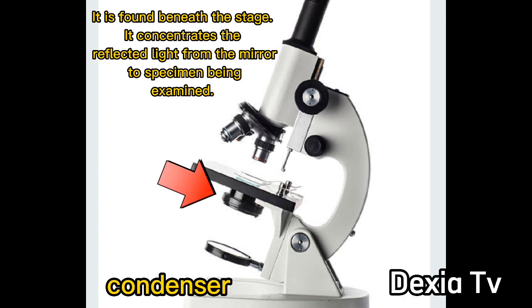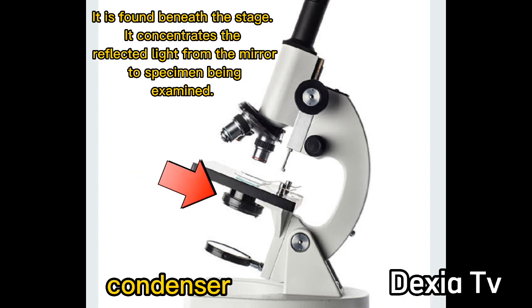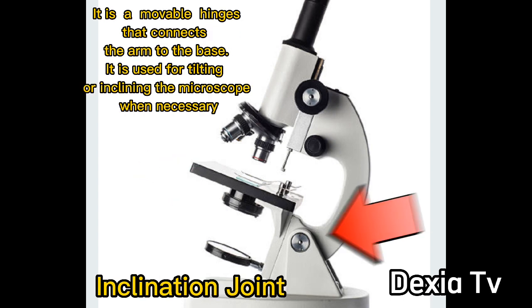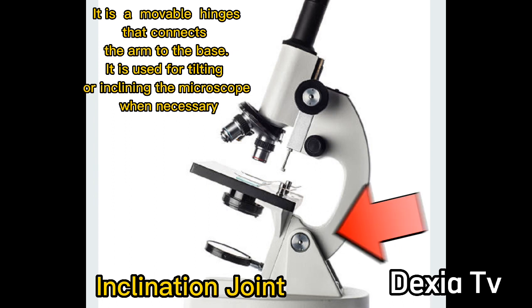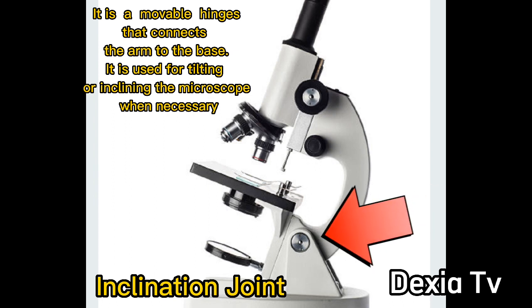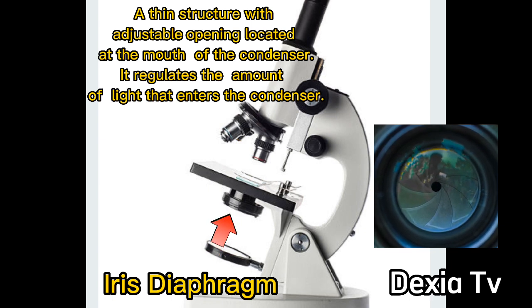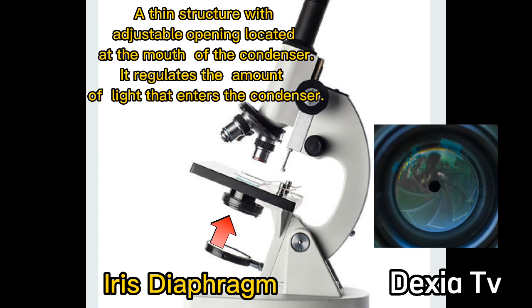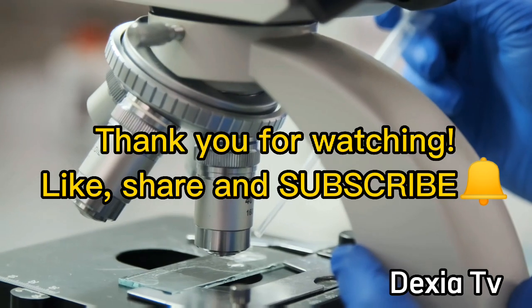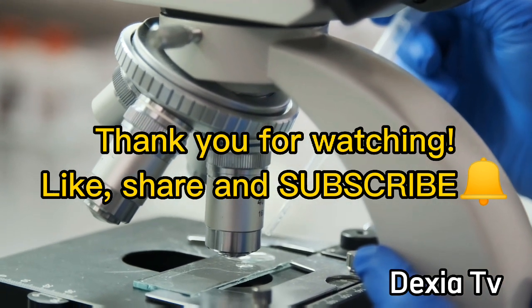Condenser: It is found beneath the stage. It concentrates the reflected light from the mirror to the specimen being examined. Inclination joint: It is used for tilting or inclining the microscope when necessary. Iris Diaphragm: A thin structure with adjustable opening located at the mouth of the condenser.